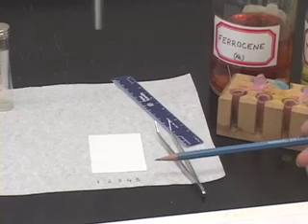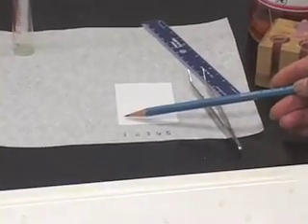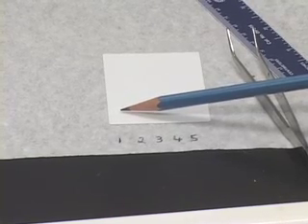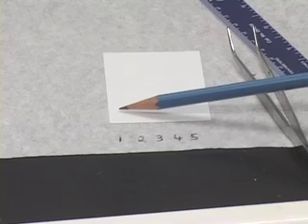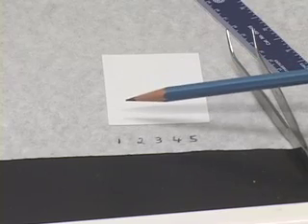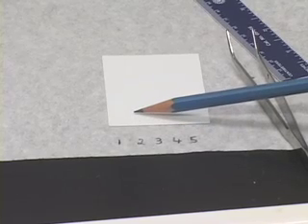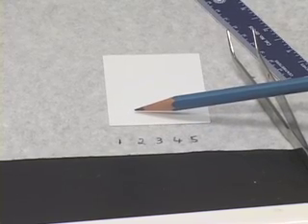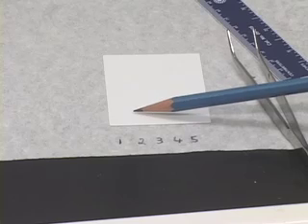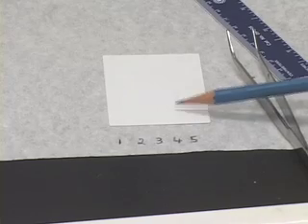So, what you want to do is apply standard 1 here, and if you selected 2 times application as the ideal application, you want to touch the capillary twice of standard 1 there, and using a different capillary dedicated solely to standard 2, you apply standard 2 here, on spot number 2, apply it twice, and in the same fashion apply 4 standards.